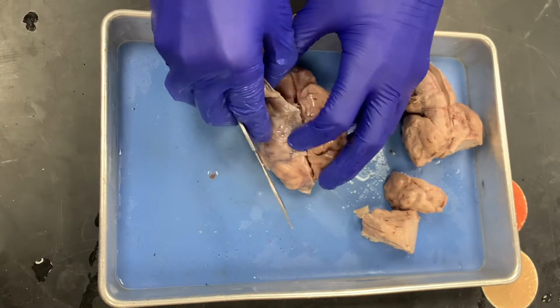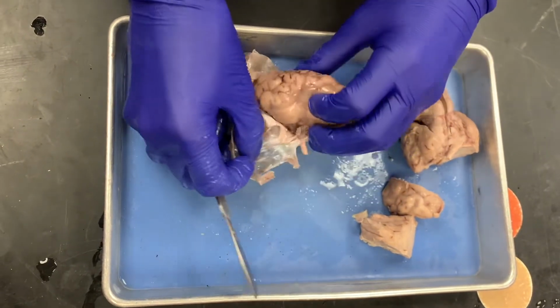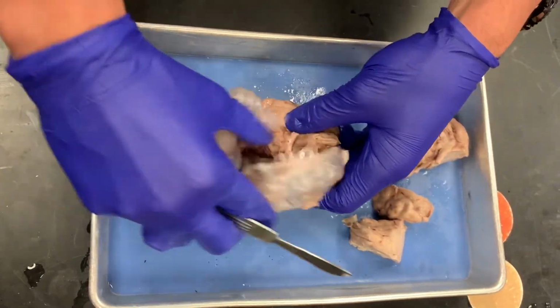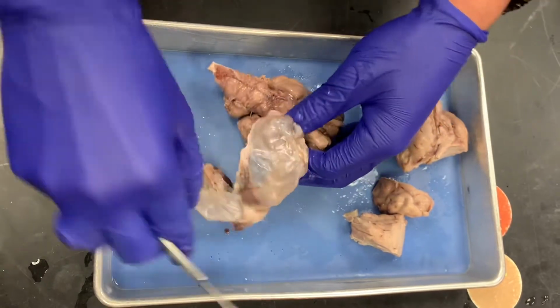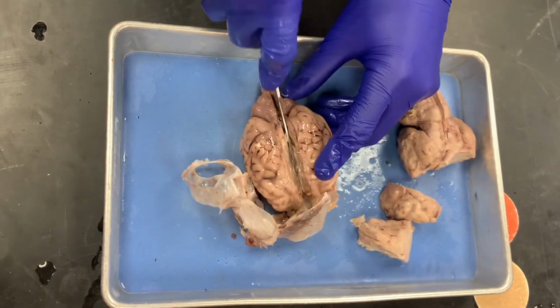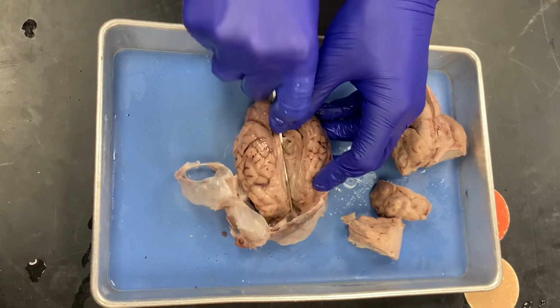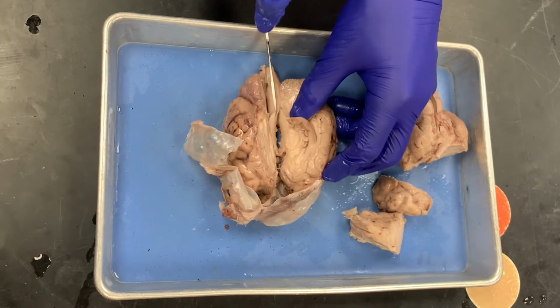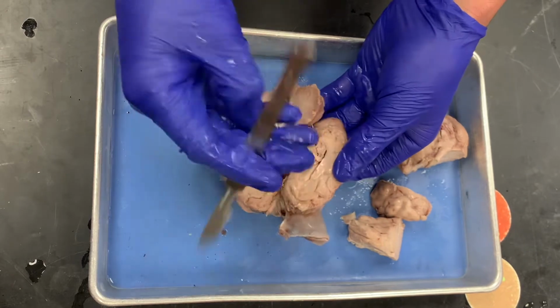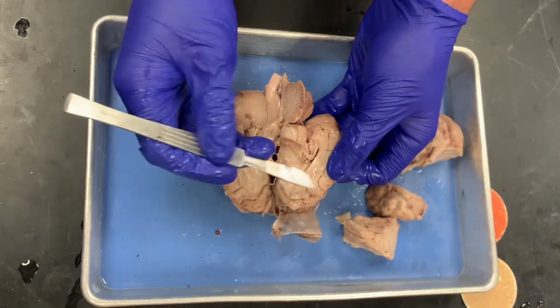Okay, so let's take the rest of the dural cap off so we can see some of the other brain structures. So I'm going to take it off, and then we can do a mid-sagittal section. So I'm going to cut it here. I'm cutting the cerebellum, so that's what this part is, and then I'll cut it right here down the middle. Okay, so now if you look at it from this point of view, you can see the corpus callosum, which is this part right there. It's connecting the right and the left halves.